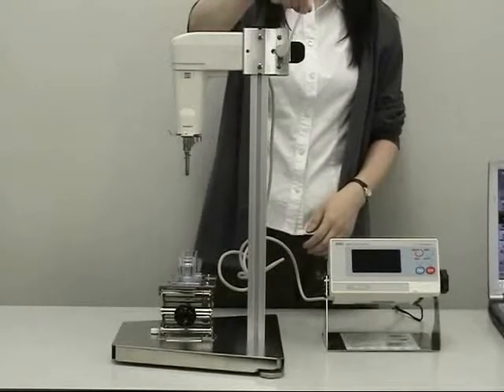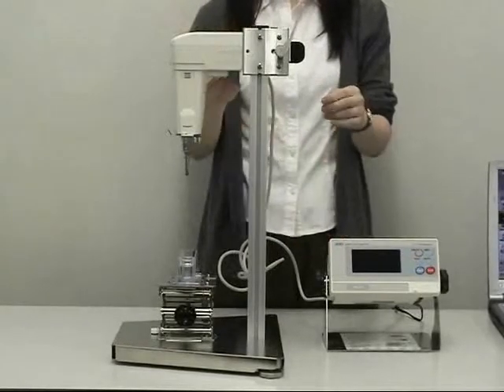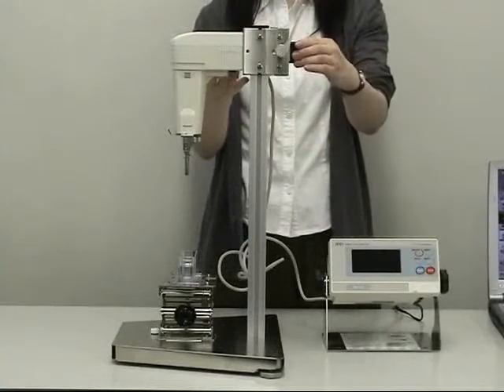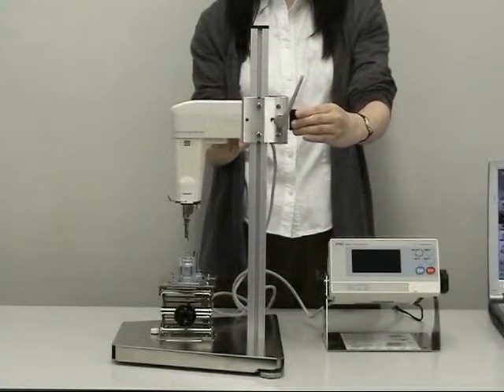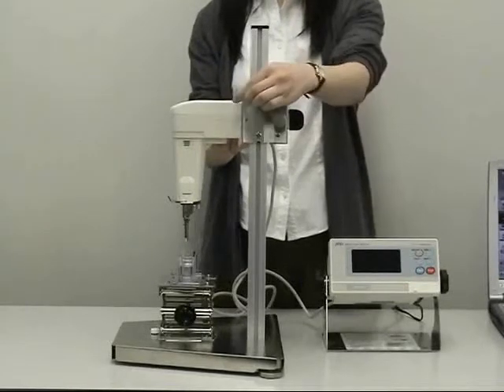Loosen the lever, support the sensor unit, pinch and hold the grip, move the sensor unit, release the grip and fasten the lever.